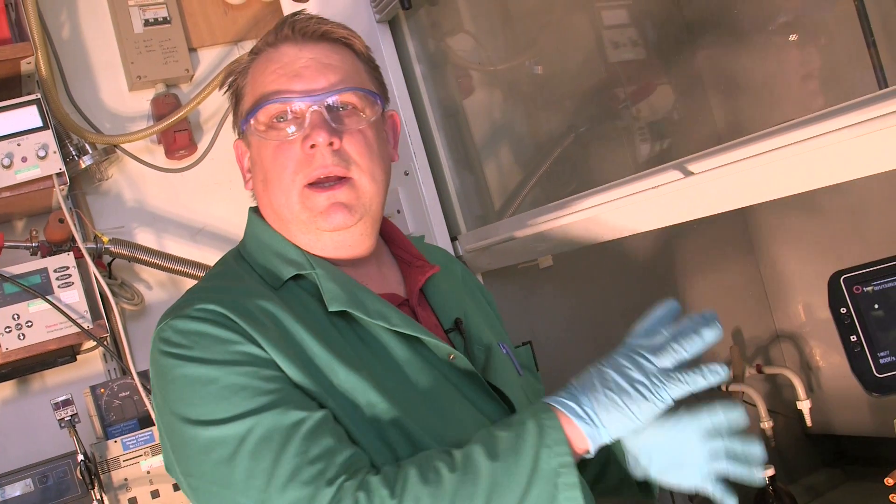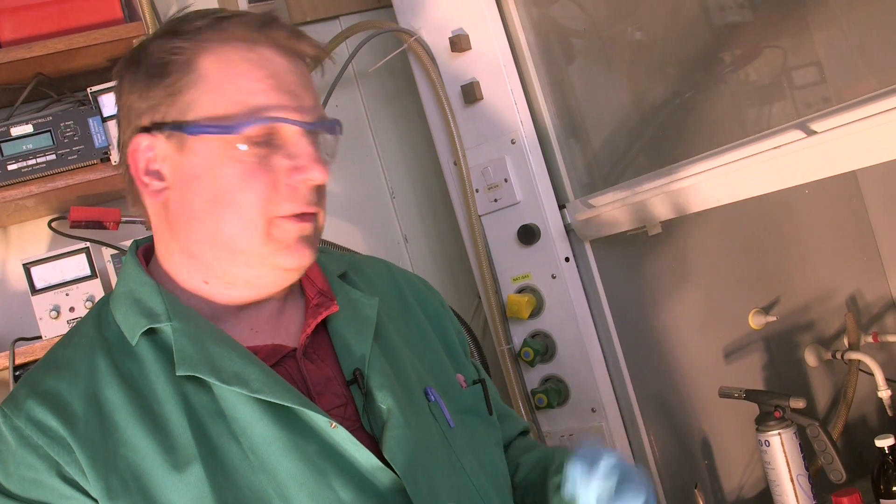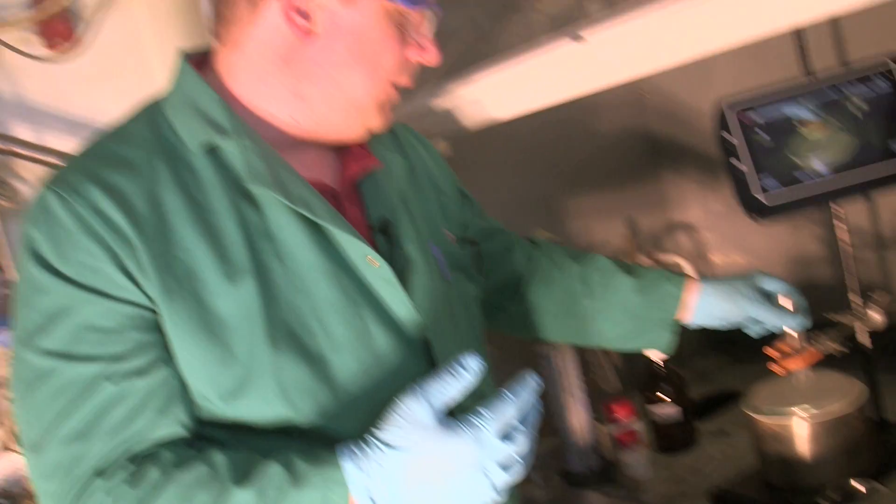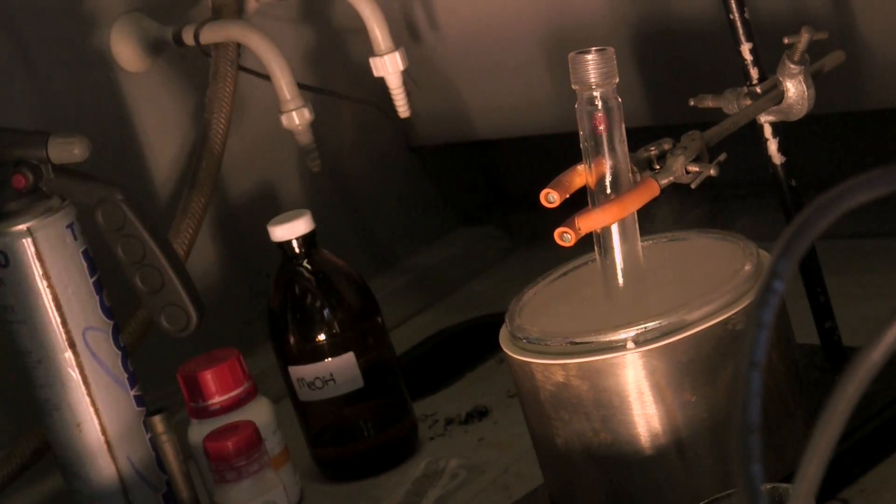So as we put the sodium in, you'll see that blue color forming. It will obviously heat up because there's some solvation going on, some heat of solvation, so we'll have to dunk it back into the cold bath just to stop all the ammonia from boiling off.